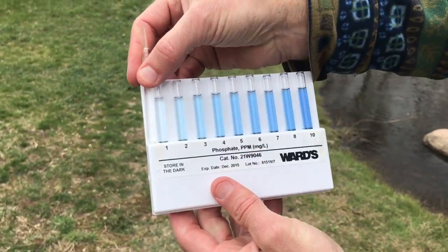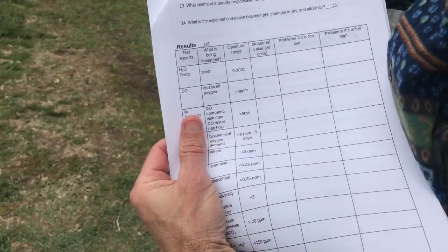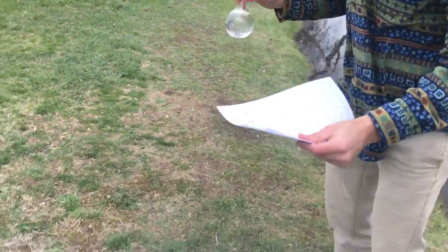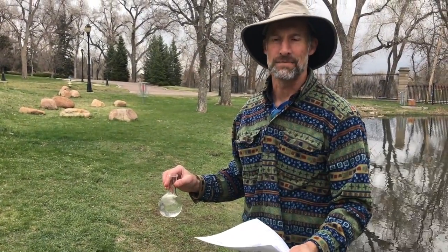We're not getting a lot of fertilizer runoff on there, but there's something called turbidity, which we're also going to measure. This is a measure of water clarity or lack of clarity. The higher the number, the more cloudy the water is. So this is from suspended solids.